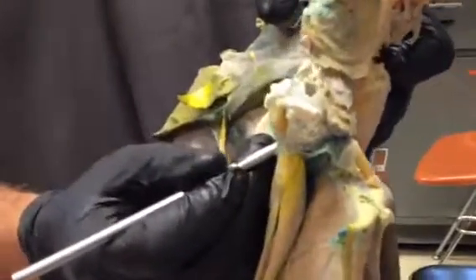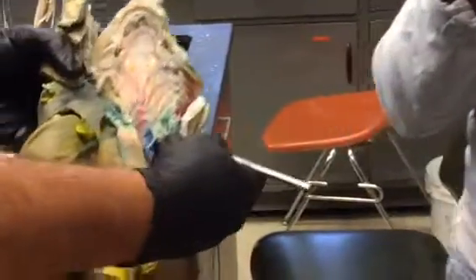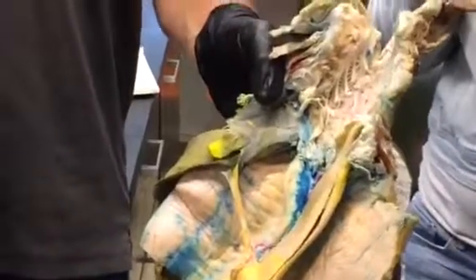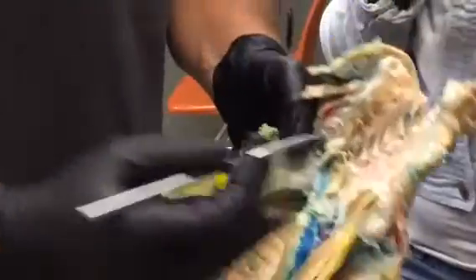Aorta and its branches. There's a branch that comes off the dorsal aorta and runs over to the pectoral fin. You can see that right there. And that is the subclavian artery. Okay. And this is one that, again, we'll see in all jawed vertebrates. It basically supplies blood to the pectoral fin or pectoral limb. It's called subclavian because in mammals it runs right under the clavicle, and then it goes over to the limb. So that's the subclavian artery.